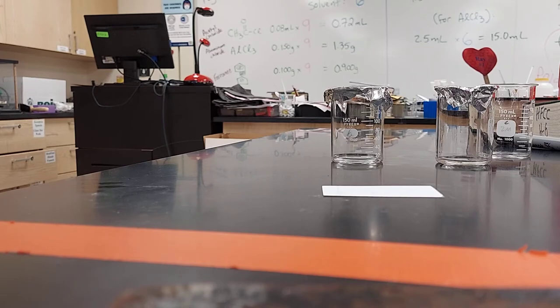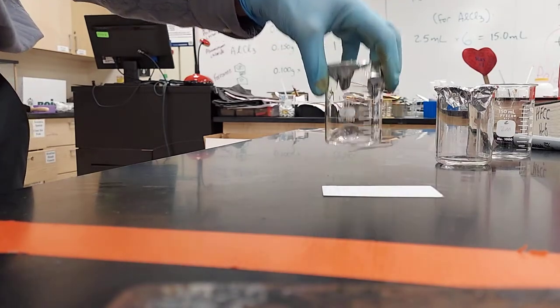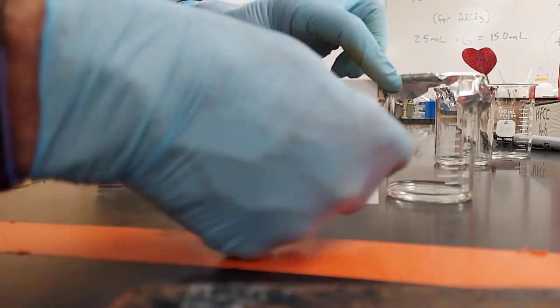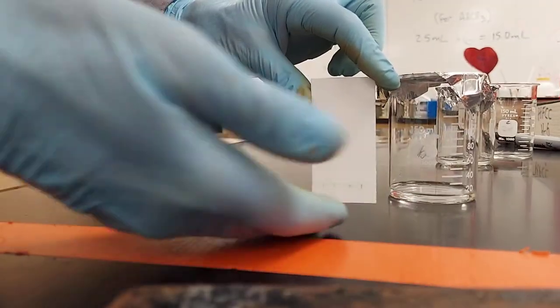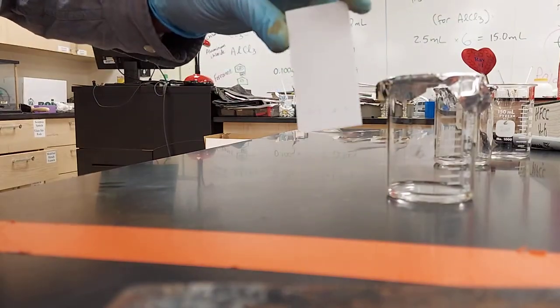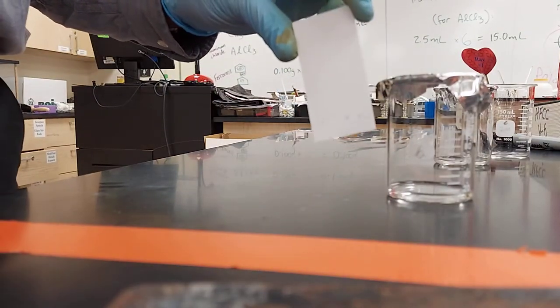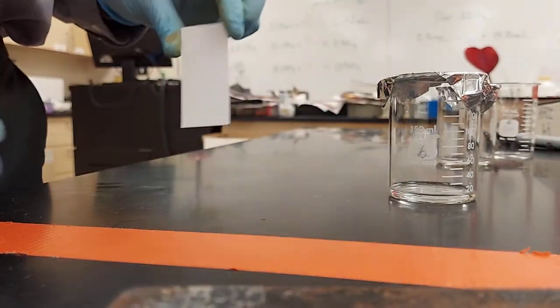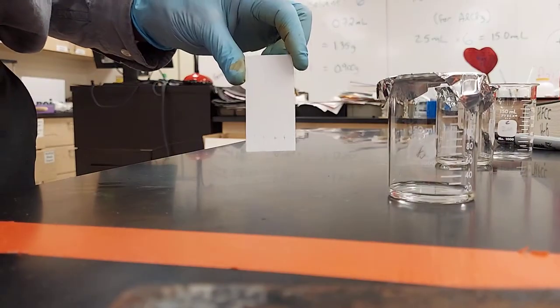So we had a couple good questions. Why is it that we put only one centimeter of solvent? It's because when I put my TLC plate in there, I don't want the spots going sideways. I want them only going up with the liquid. So if they're already surrounded by liquid, that means you added more than a centimeter, and the spots will spread sideways. We don't want that.